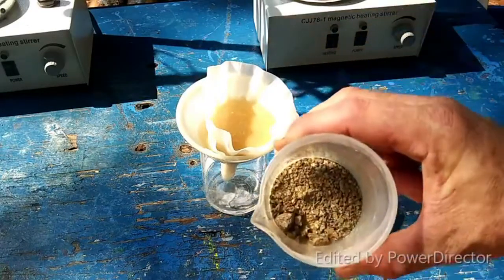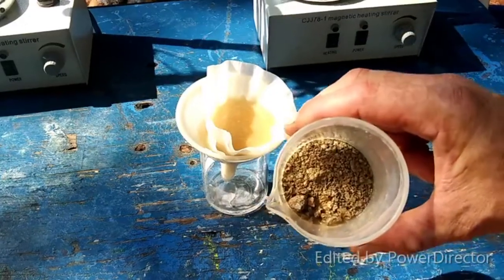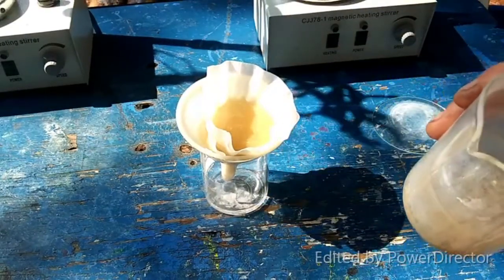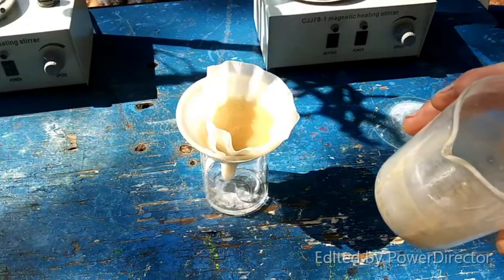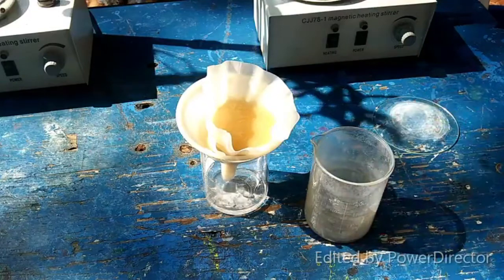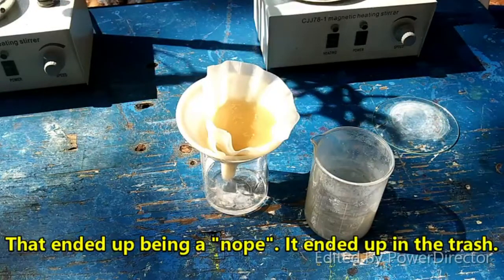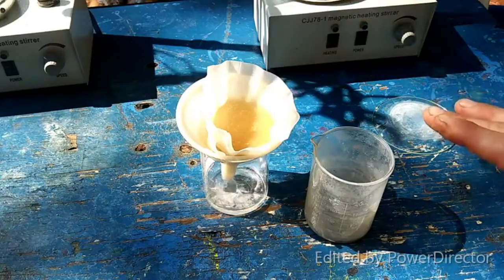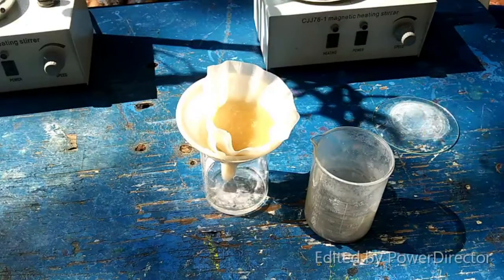That is what we have left over. It kind of sucks actually, because it looks like it's still contaminated with some lead. Well, I can recycle it — I'll come up with something to do with it. But I'm going to rinse it with a little bit of water, pour that in here, and once it is completely filtered, I will come back and we will do our next step.